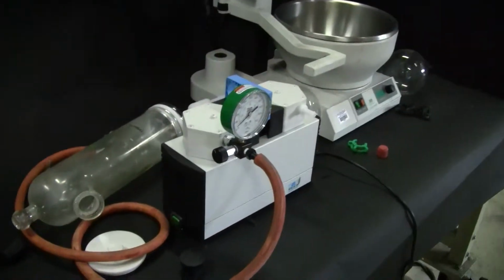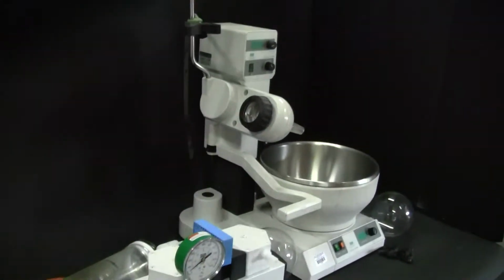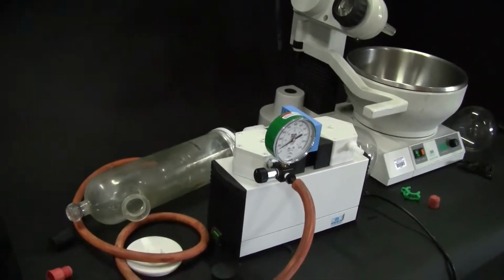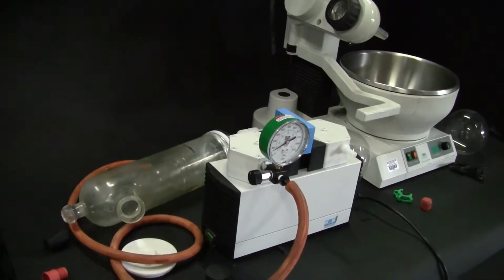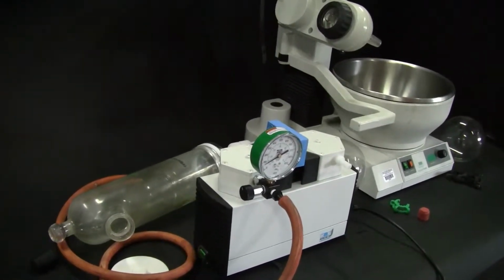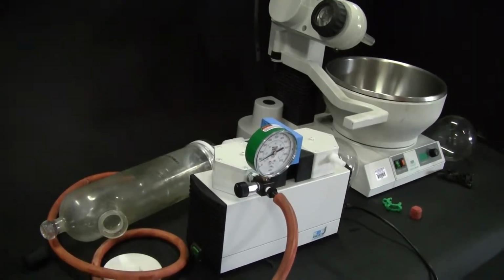Today, in our last video, we set up our glassware. We were about to shoot a product video, and we identified that we had a vacuum leak. Well, what I wanted to show you was how I troubleshoot a piece of used glassware. What I do is I identify or target a particular section and test that section individually. Then, as I rebuild it, keep applying more pieces.